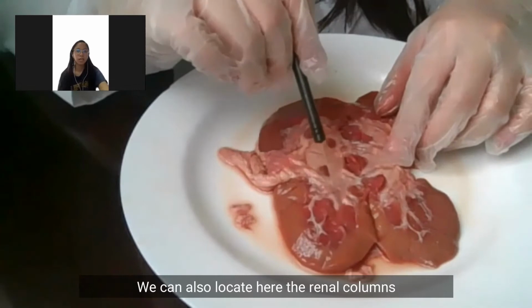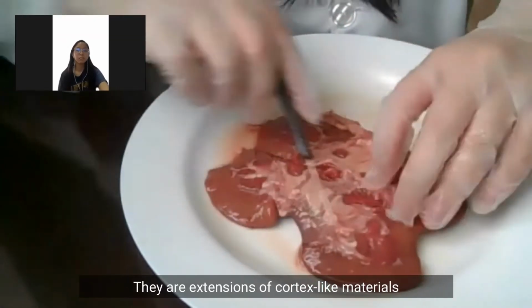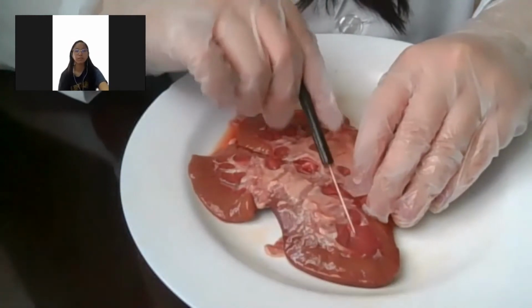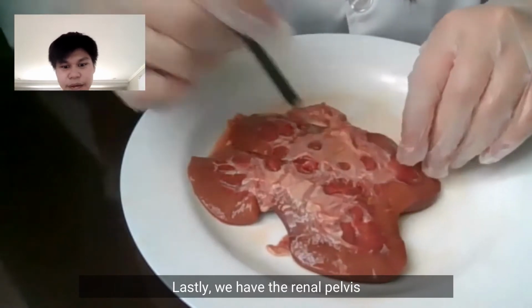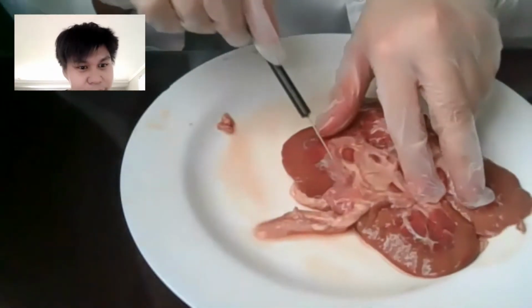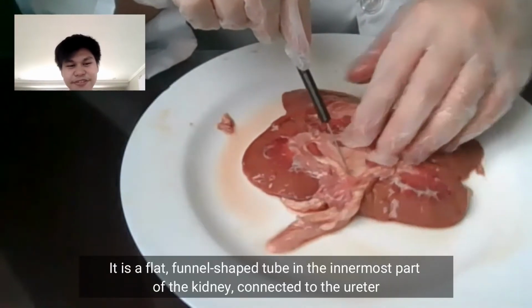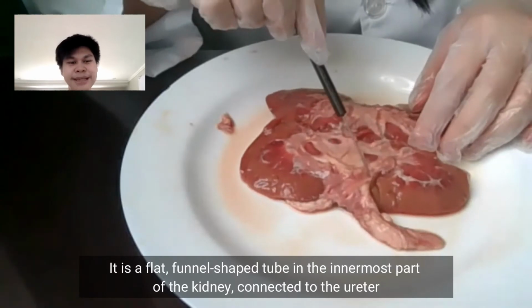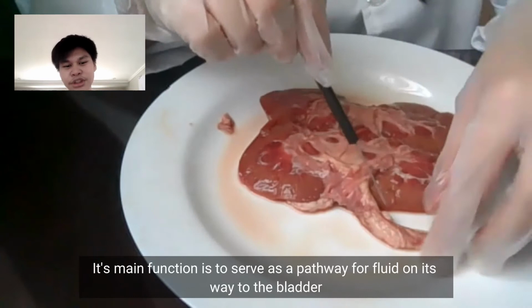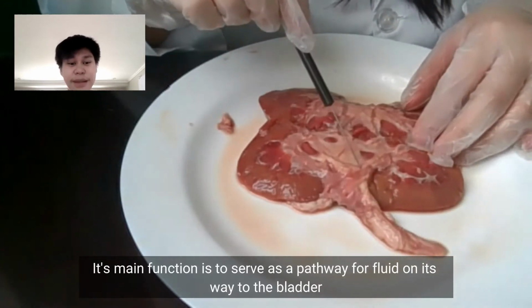We can also locate here the renal columns. They are extensions of cortex-like material responsible for separating the renal pyramids. So lastly, we have the renal pelvis there, located in the medial region. It is a flat funnel-shaped tube in the innermost part of the kidney, connected to the ureter. Its main function is to serve as a pathway for fluid on its way to the bladder.